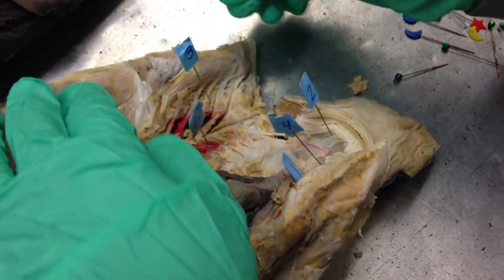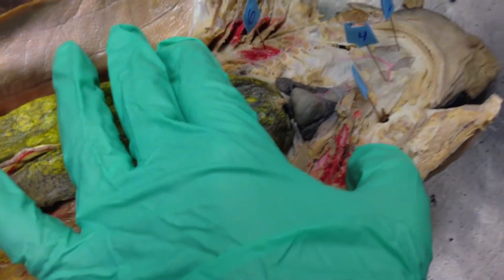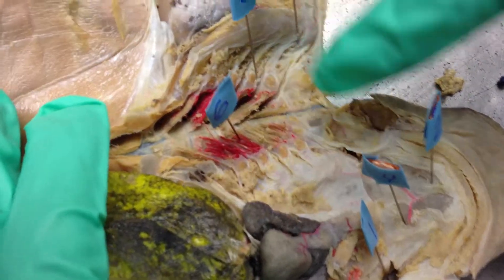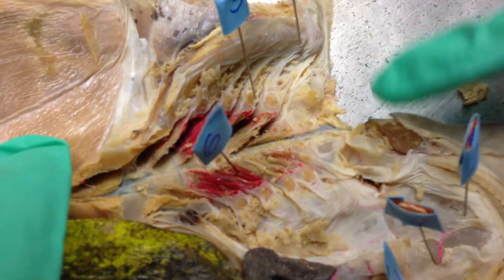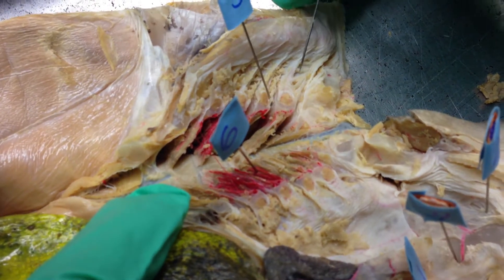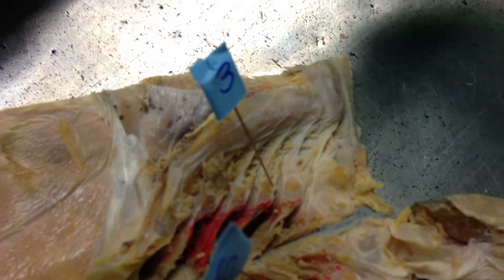And then the five gill slits are over here — you can see the gill slits. Number five points at the gill rakers, which are these spiky looking things right here inside the gills — the gill rakers.